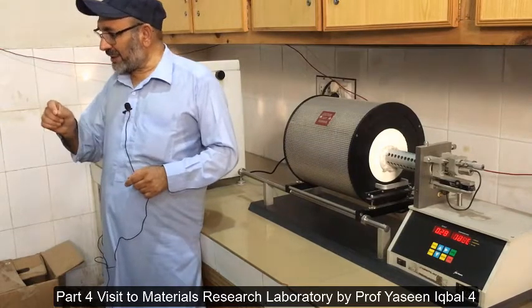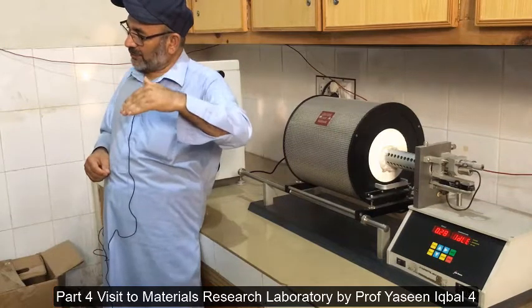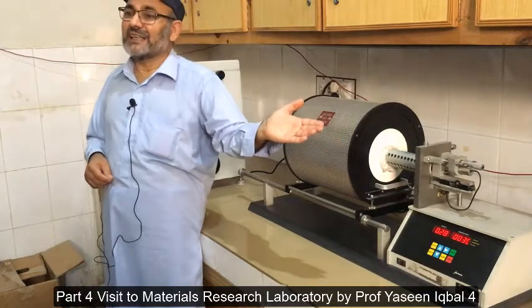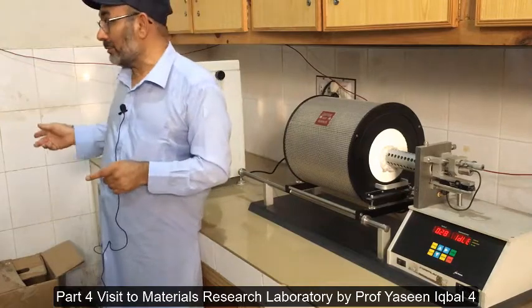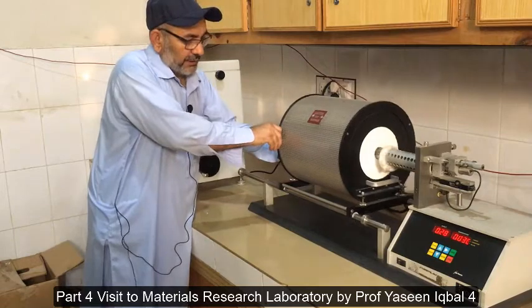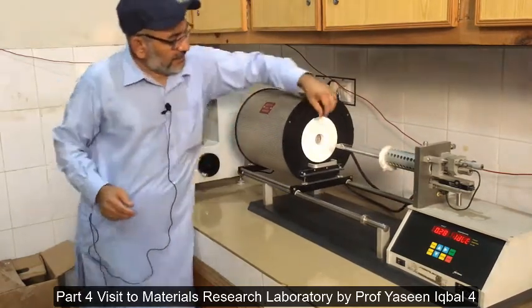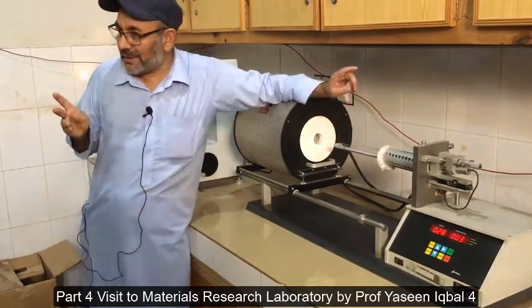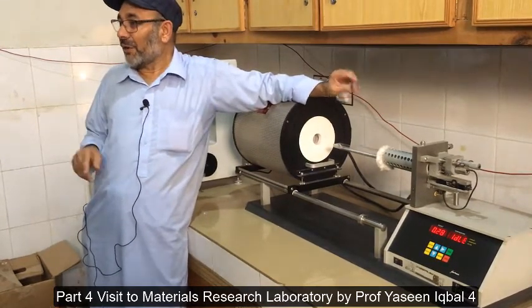You melt the material, then you suddenly cool it down to the glass transition temperature, slightly below it, and then anneal it in the next phase. So when you don't know the glass transition temperature, you can't do that. This machine tells you about the glass transition temperature of the material. The sample is placed here.